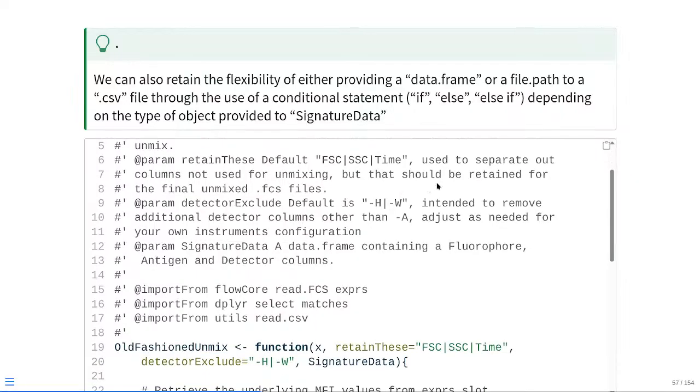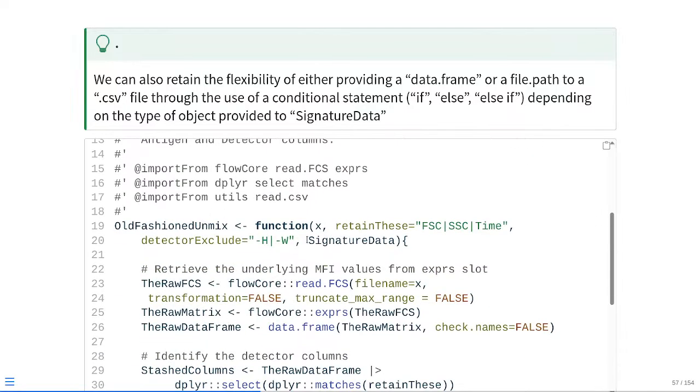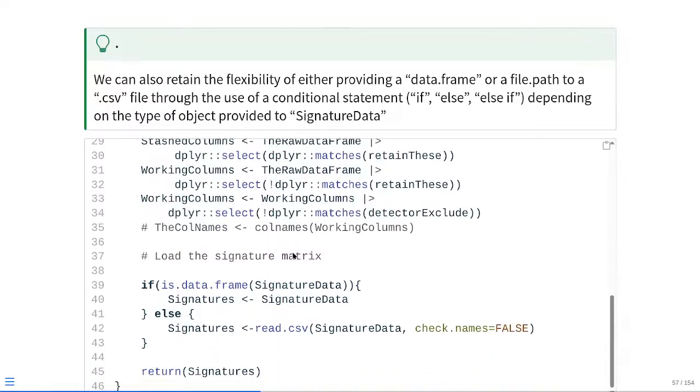So what this is going to look like in practice, we're adding a new argument, so we're documenting it within our at params. And then at that point, placing that new argument between the parentheses. And as you can see, we're starting on a new third little chunk of code inside here. So I'm just going to give it a new comment saying what we're doing.